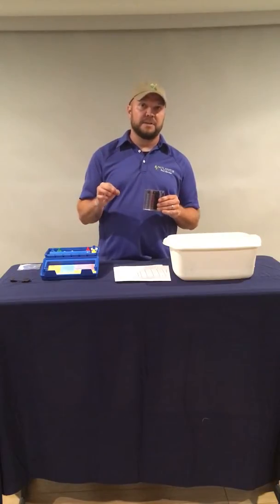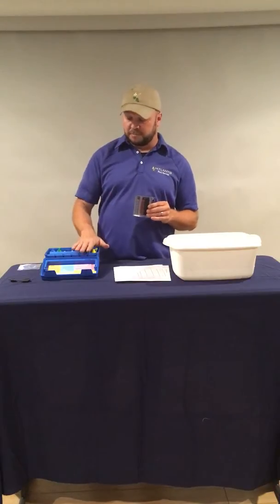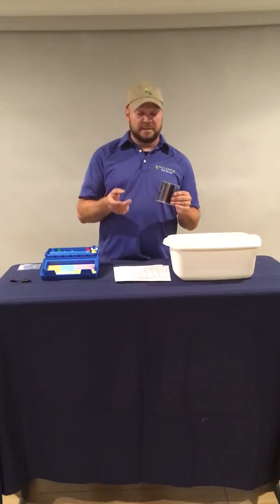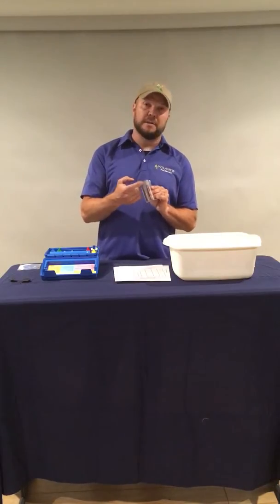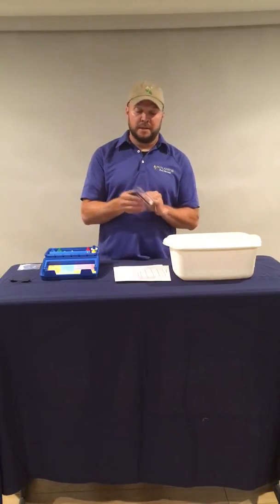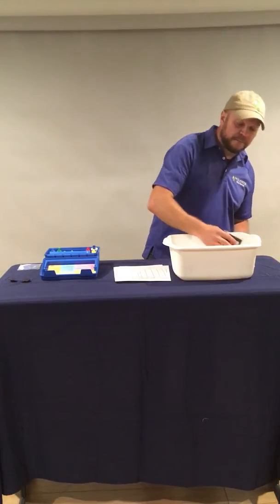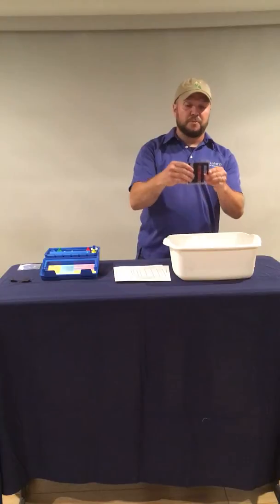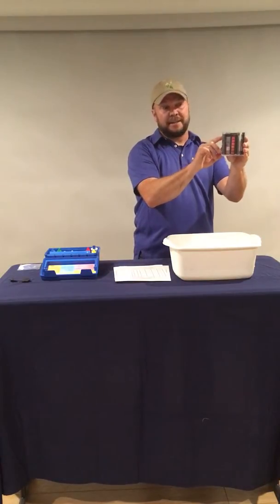We want precision here. We're looking to get the most precise test result that this kit can give us. And 0.2 is much more accurate than 0.5. So that's what we're going to do. We're going to fill the comparator up to the higher level so we get a 0.2 test. So what we do is, as we said in the previous section, take a sample of water from at least 12 inches below the surface of the pool, and then we're looking at our comparator and making sure that the water is filled exactly to the line.